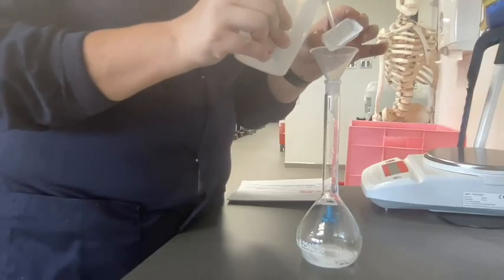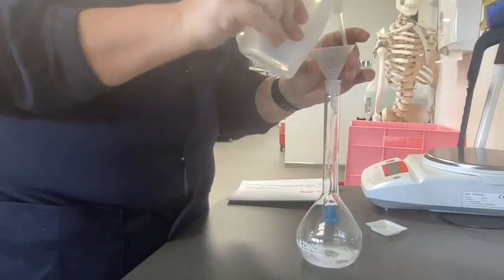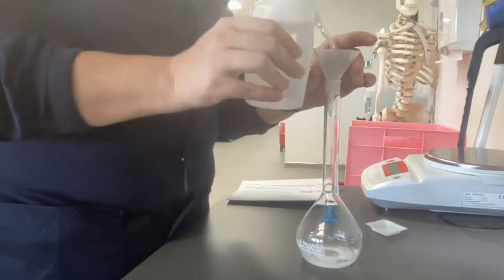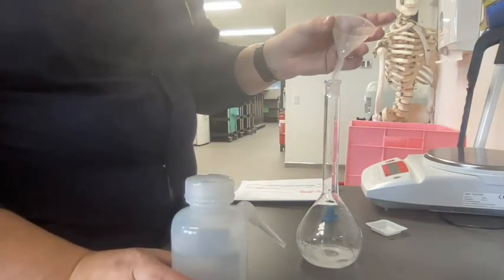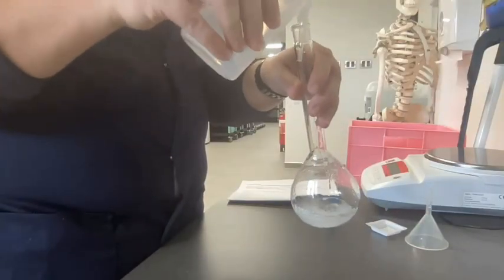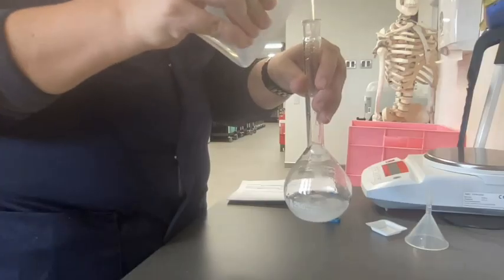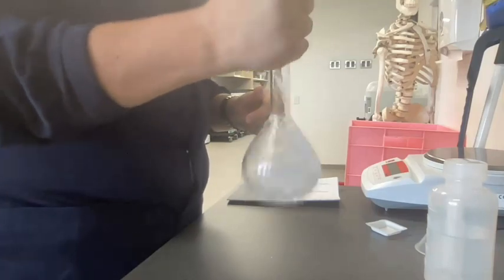Once I'm sure I've got every tiny little speck in there, I can put that to the side. I can make sure that my funnel has everything washed through as well. And once I'm sure that all of those things are free of the sodium carbonate, you can see in the bottom there I've got the solid and a little bit of water. I'm just going to put in a bit more distilled water so that I can dissolve it. So at this point I haven't filled it all the way, okay, but I filled it enough that I can put the stopper in the top and give it a nice shake to dissolve it all.